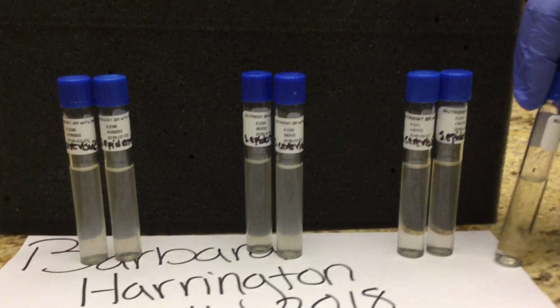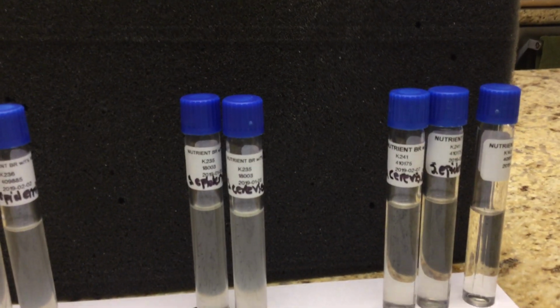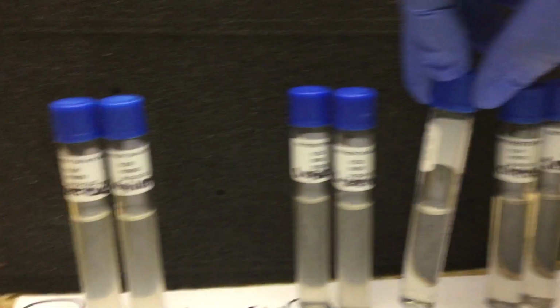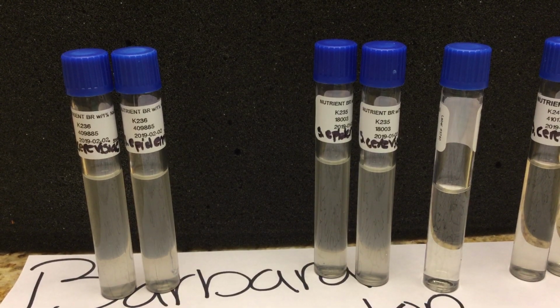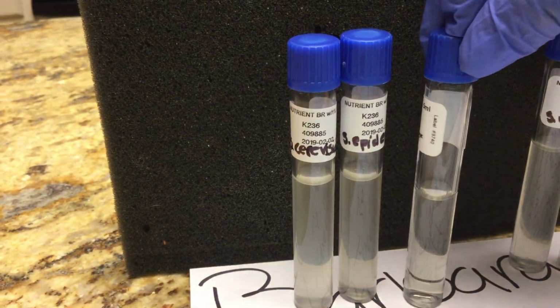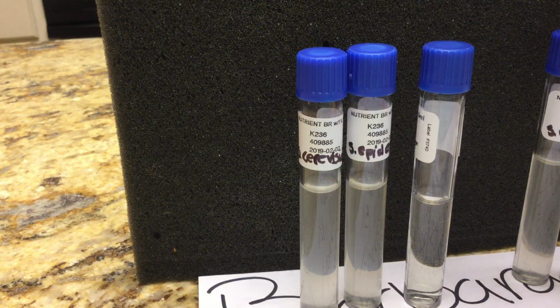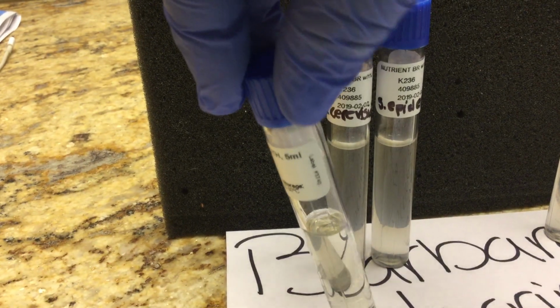For our 15% sodium chloride, for S. cerevisiae and S. epidermis, I would say that there's no growth, no turbidity in either of those, comparing to our non-inoculated nutrient broth. Then for our 7% sodium chloride, I would say that is positive turbidity, positive growth compared to our non-inoculated nutrient broth here for both S. epidermis and S. cerevisiae. And finally, we have our 1% sodium chloride for both S. cerevisiae and S. epidermis. And I would also conclude that there is positive turbidity, positive growth in both of those.